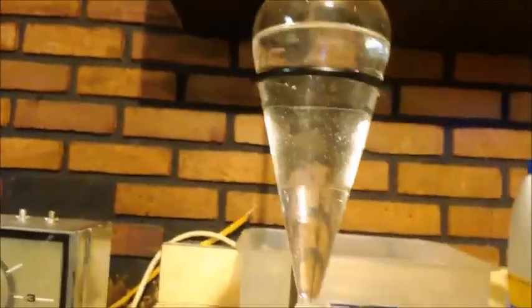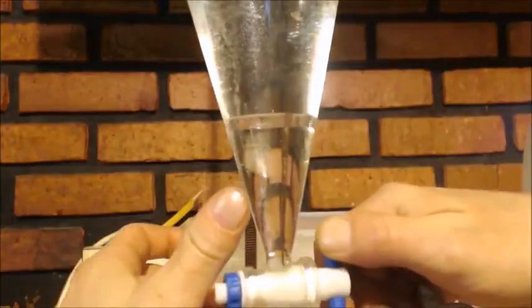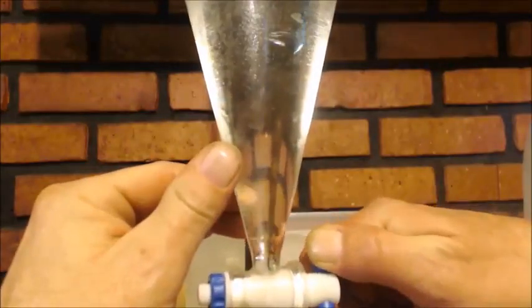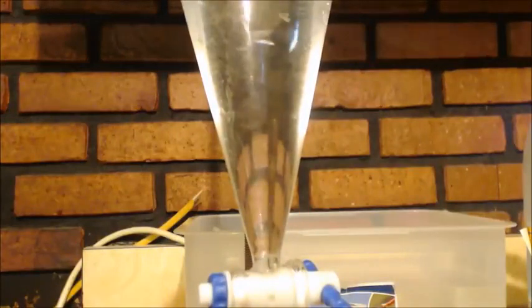I definitely got a better yield this time. Well, you can see I put in a separatory funnel. Here's the line in case you can't see it. Alright, I'm going to drain it out into a container, see how many milliliters is there. Give it a little spin here. I'll let that sit for a minute and get the rest of that out. There's only like a milliliter or two there. Let's see what we got. We got a little over 60 milliliters. It's actually pretty clear, but there's definitely water in there.